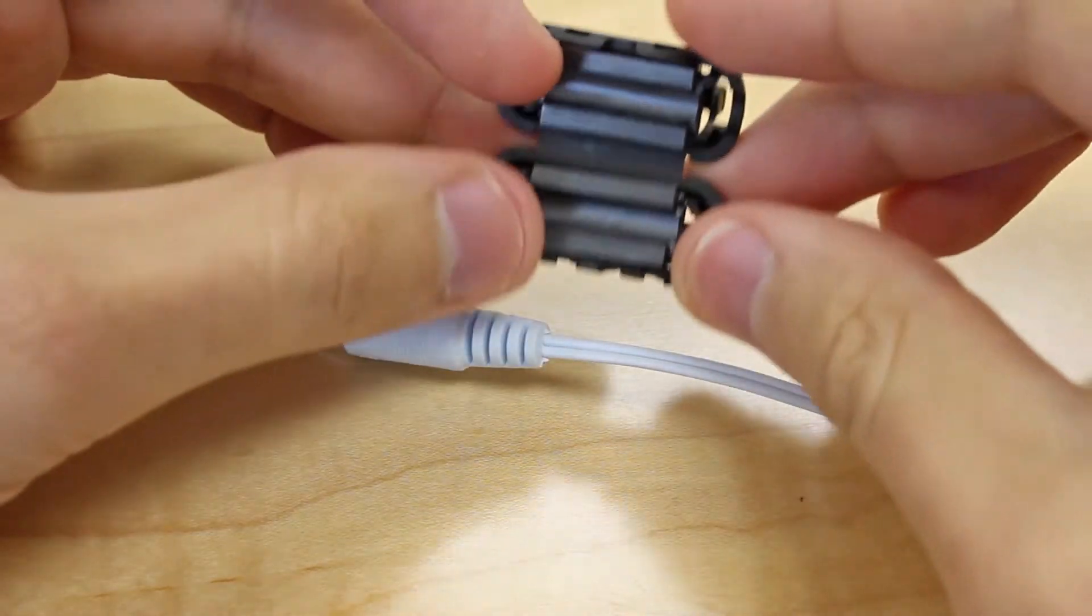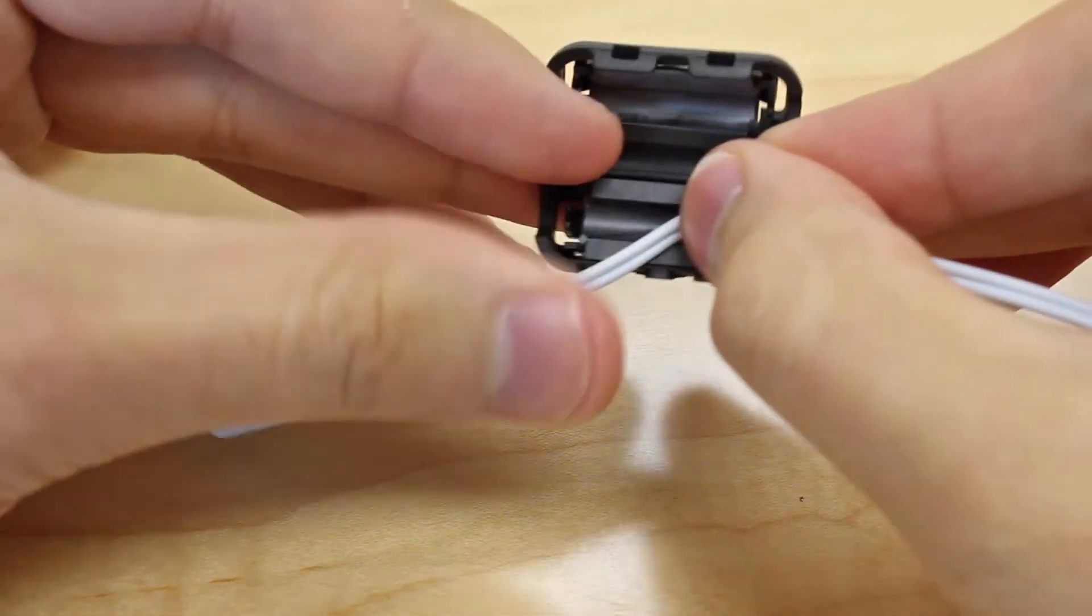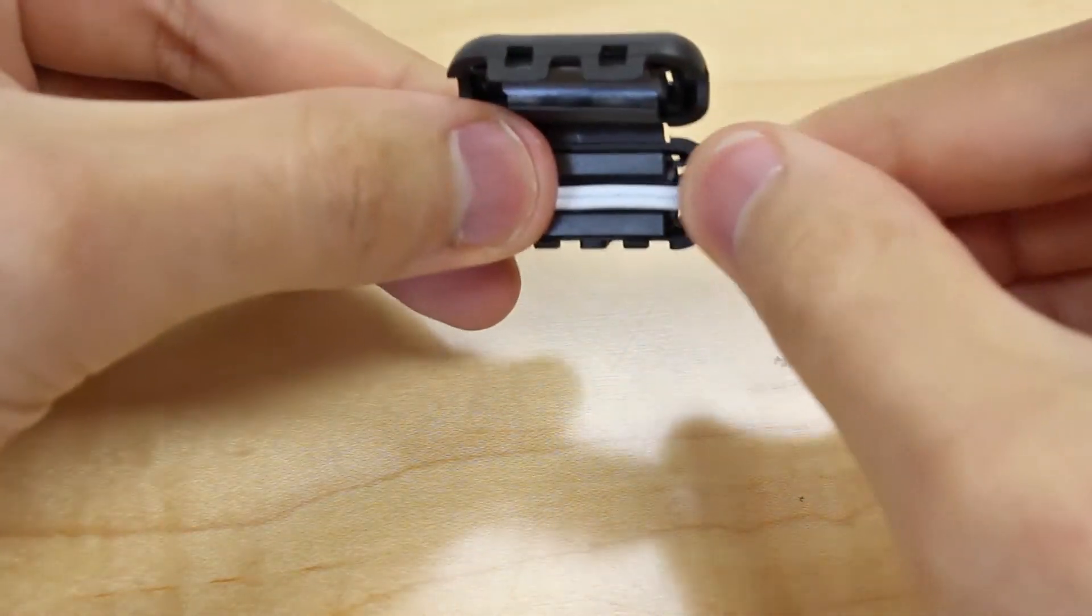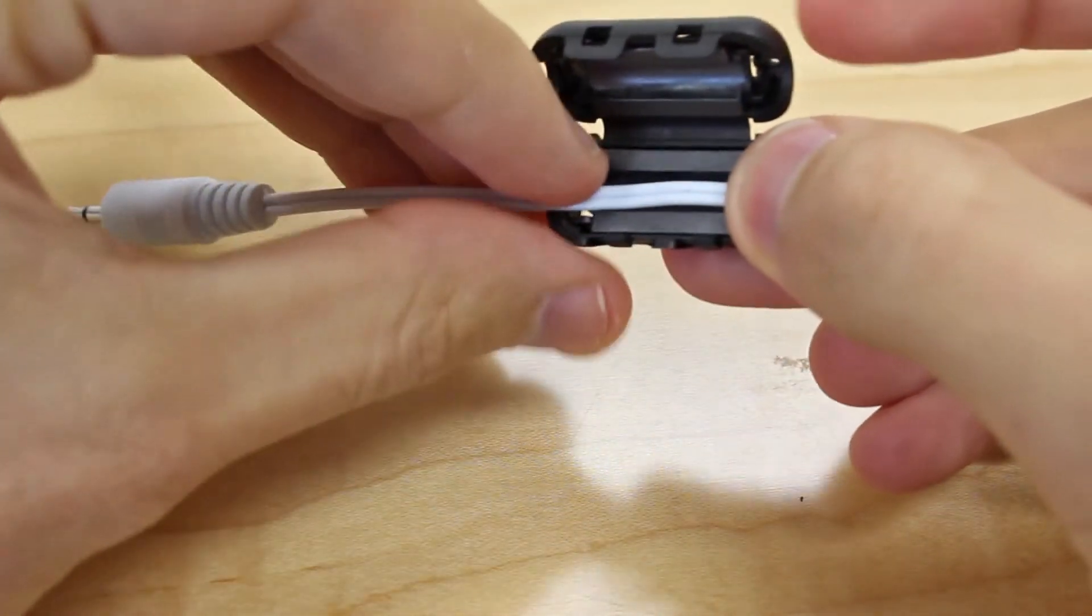First, with your probe disconnected from your thermometer and facing to the left, place the cable of the thermometer flat inside the lower half of the static suppressor.